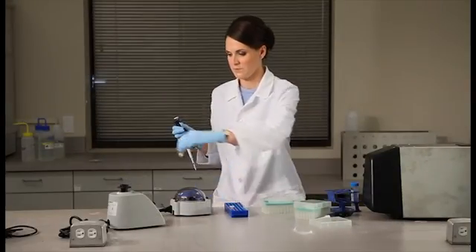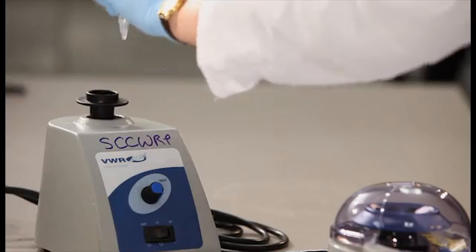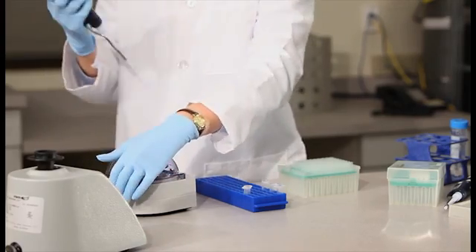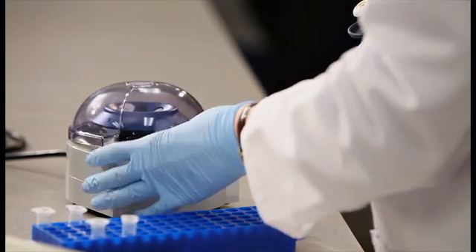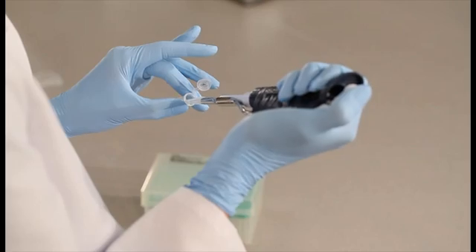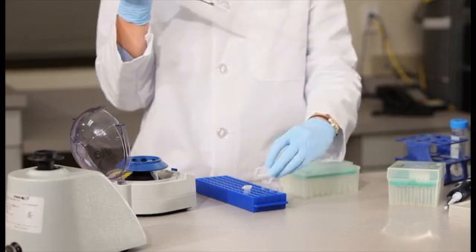To make the 1 to 10 dilution, briefly vortex and spin the DNA extract from the pre-prepared standard filter. Then, add 10 microliters to the 1 to 10 dilution tube.